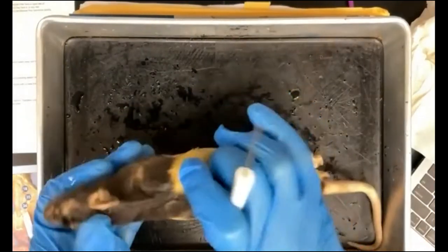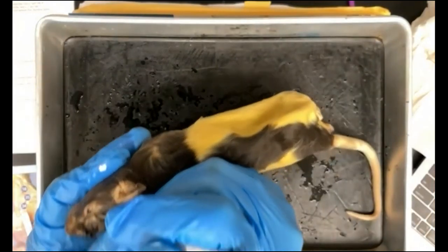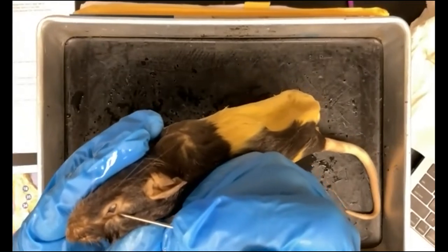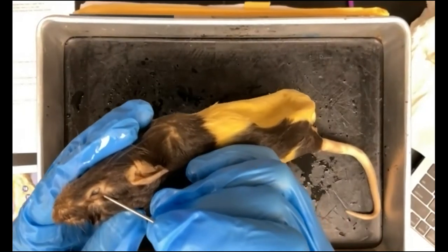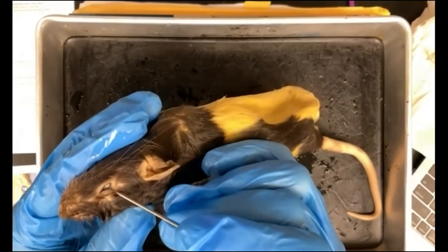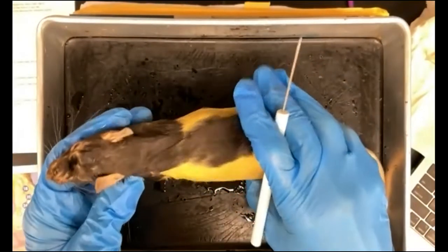Their eyelids have what are called nictitating membranes. A nictitating membrane is another, clear membrane. It can just sweep over the eye to get dust particles out of the way without having to actually close their eyes and lose vision momentarily. So that is another characteristic that they have.